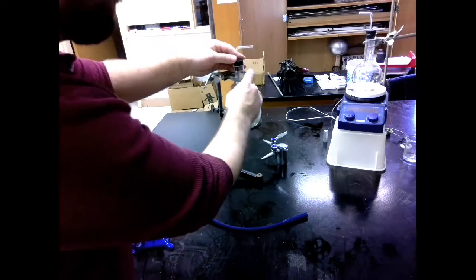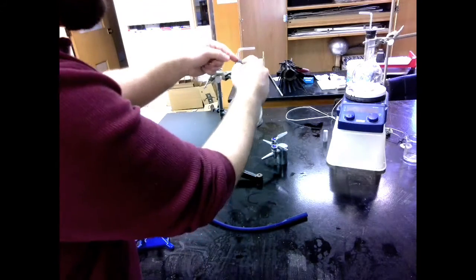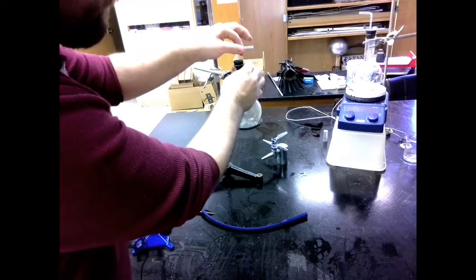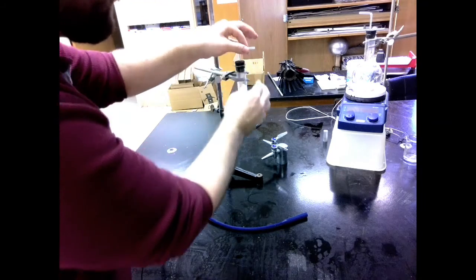Now this stopper goes in here. Once it's in, just the sheer fact of the stopper being in the glass will hold this tube in place. It'll be nice and firm. None of this is moving around too much.